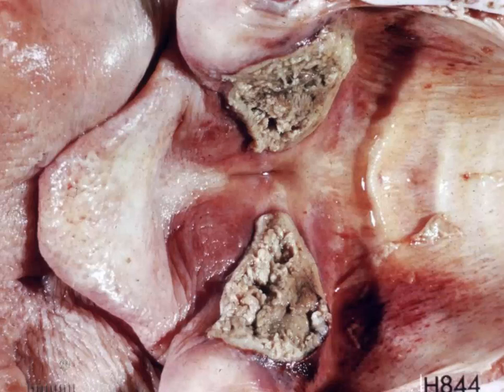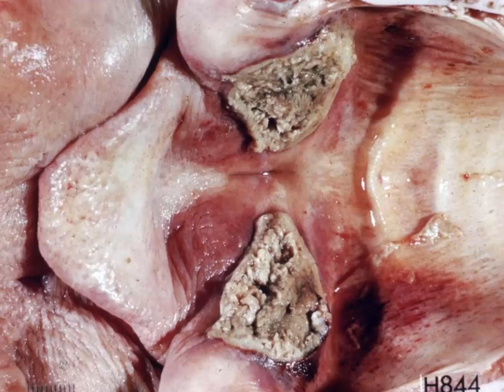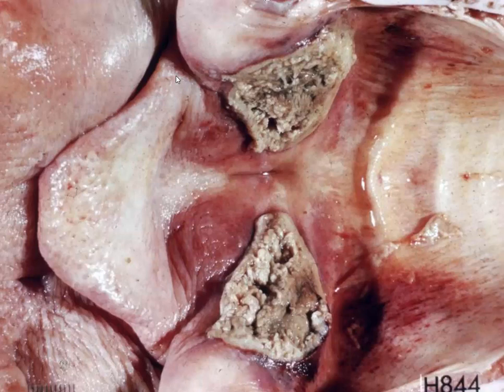This is tissue from an ox. I would like for you to give me a morphologic diagnosis and two possible causes. This is actually from a calf or a young steer, possibly from a feedlot, where you see a lot of respiratory disease.